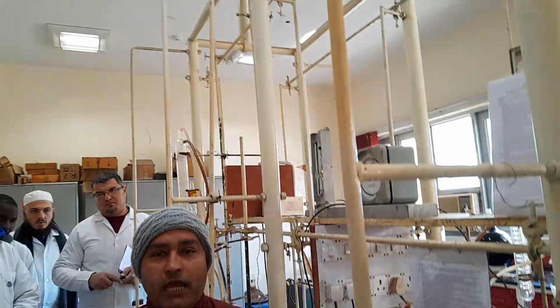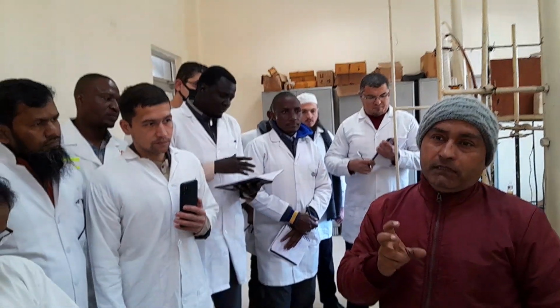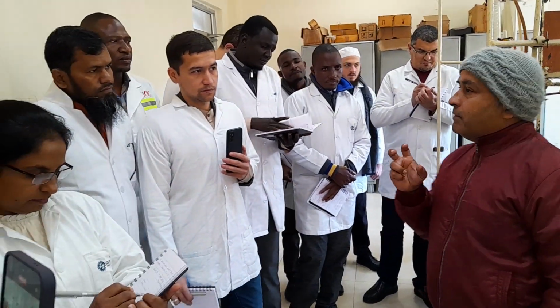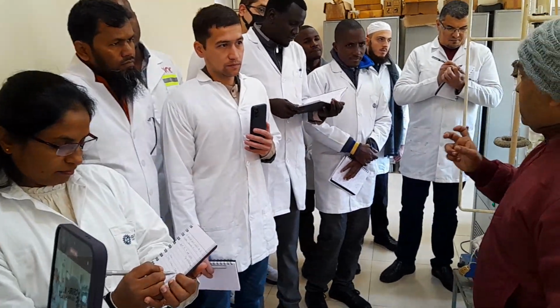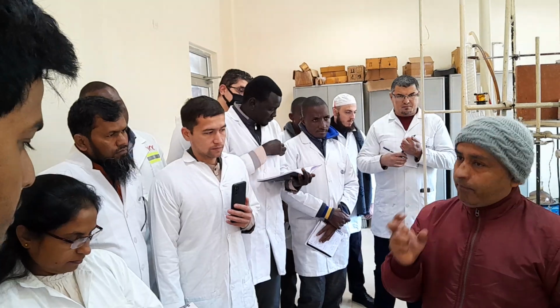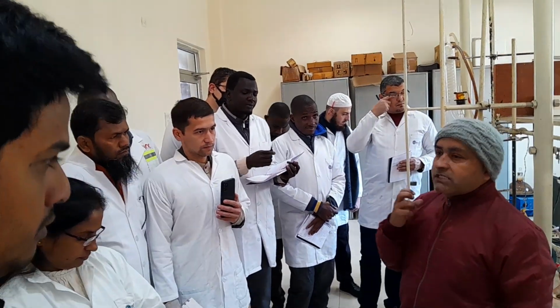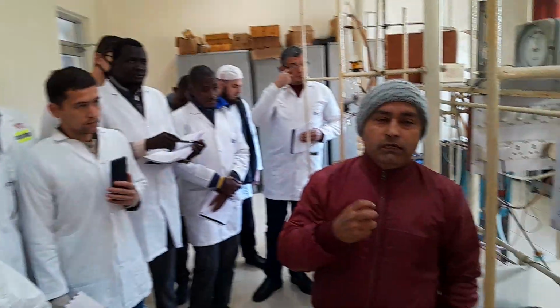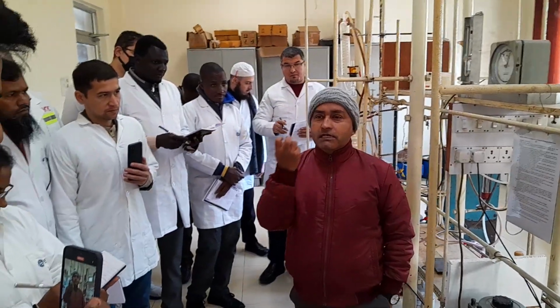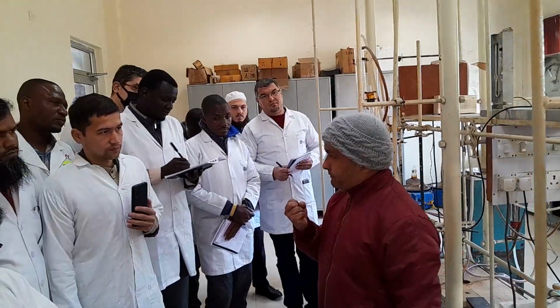So we will first check the water content by the Dean and Stark method. Dean and Stark are the scientists who designed this method. In this method, we will take 100 ml of the sample and 100 ml of the solvent. Which type of solvent is required for the water content? We will take a type of solvent which can make an azeotrope with water.